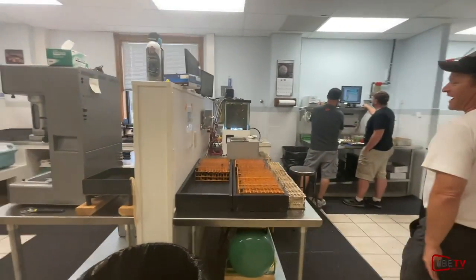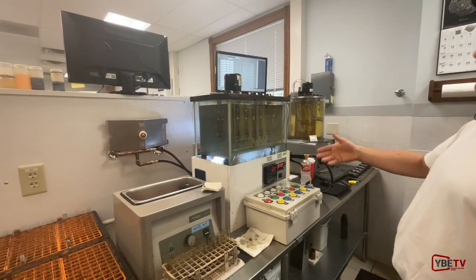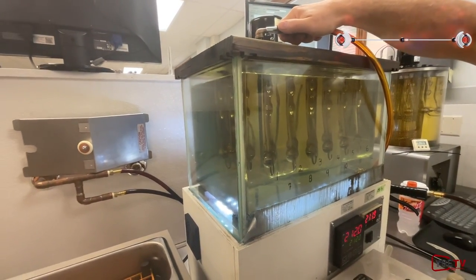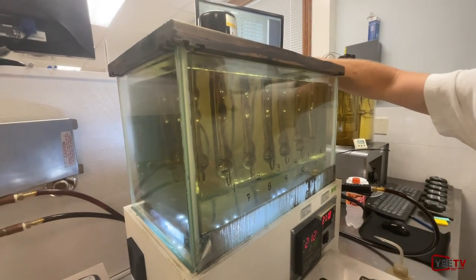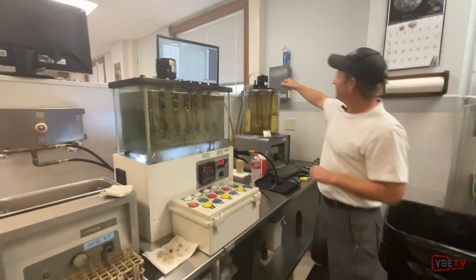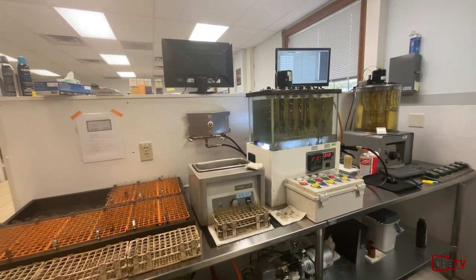Another standard test is the viscosity test. This machine tells us if an oil is a 5W30, 10W30, or 15W40. It's a simple test — we use a vacuum to draw the oil up through a calibrated tube. When the oil reaches the top line, we start a stopwatch, and when it reaches the bottom line we stop. We enter the time into a spreadsheet which calculates the viscosity. Essentially you're running the oil through a fixed orifice and measuring how long it takes — that tells you how thick or thin the oil is.